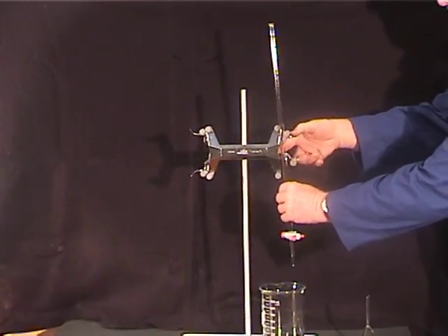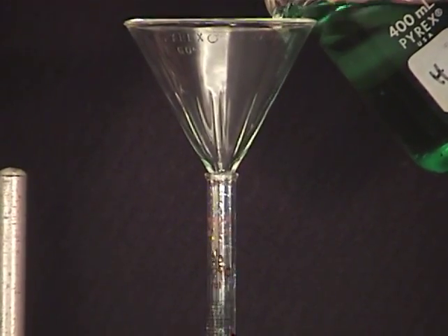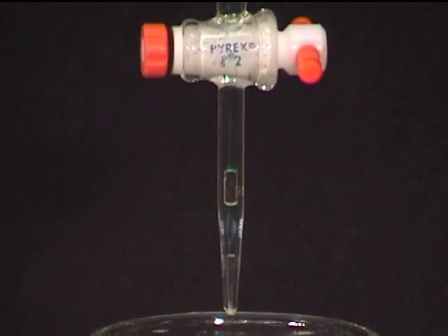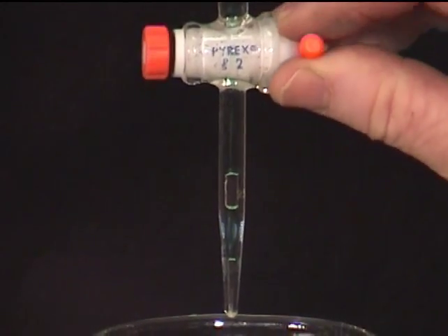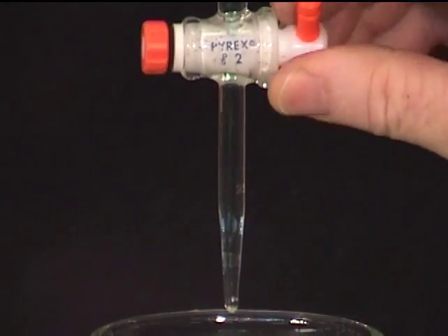Repeat this step twice more, then fill the burette with the same reagent. Fully open the stopcock to flush out any air bubble in the nozzle. If the bubble escapes during the titration, error is introduced.